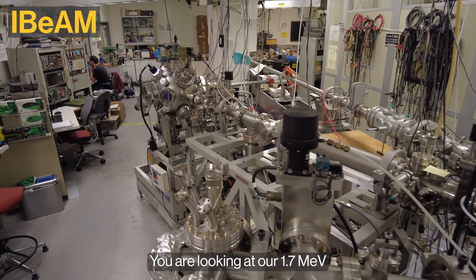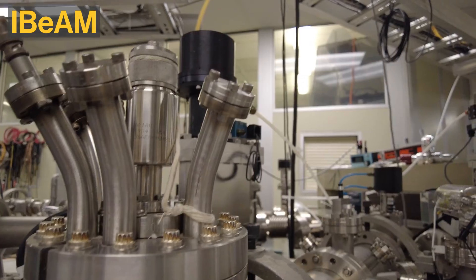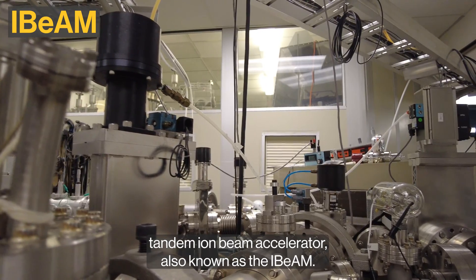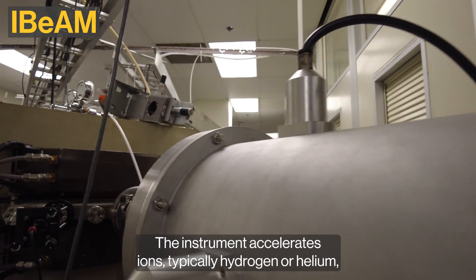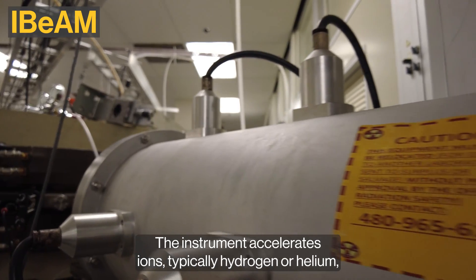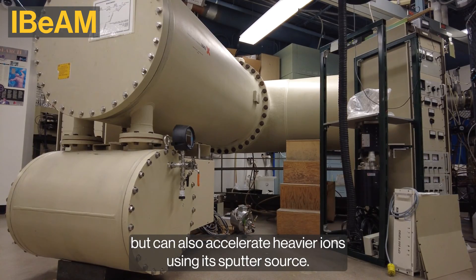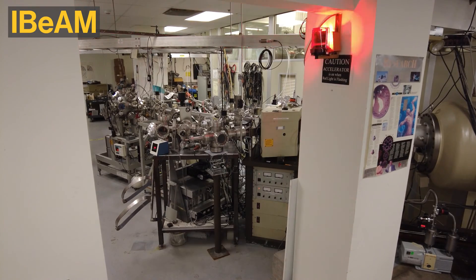You are looking at our 1.7 MeV tandem ion beam accelerator, also known as the I-beam. The instrument accelerates ions, typically hydrogen or helium, but can also accelerate heavier ions using its sputter source.